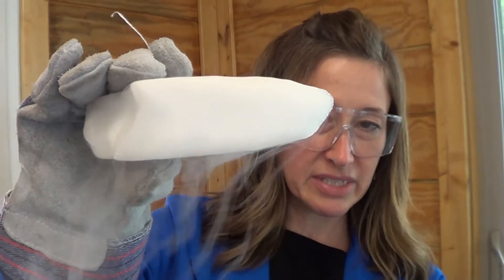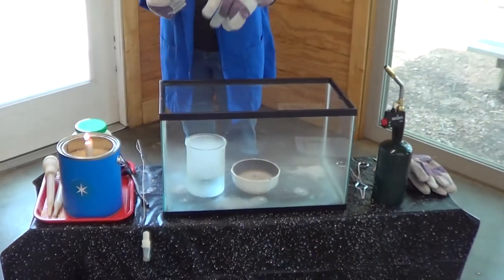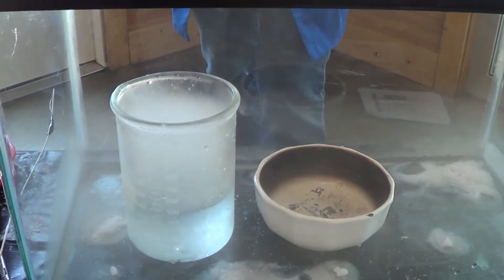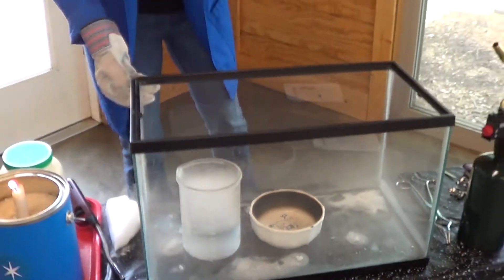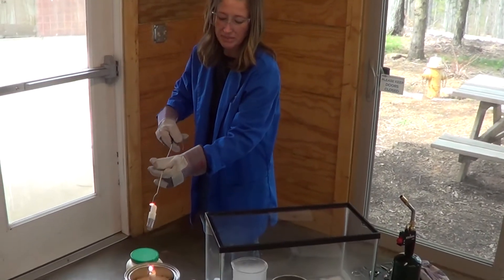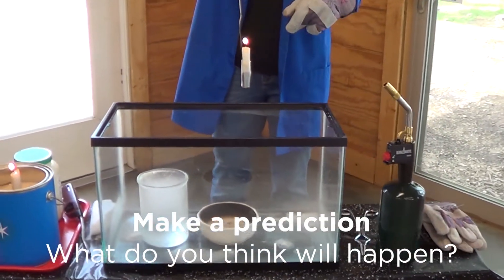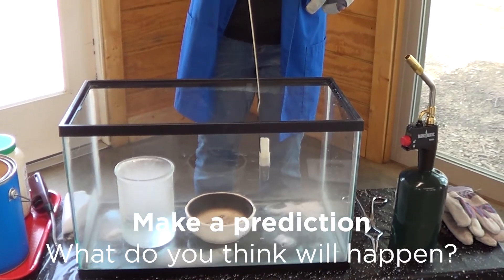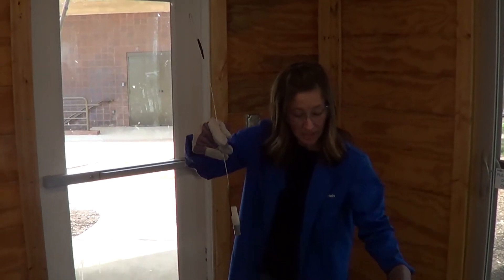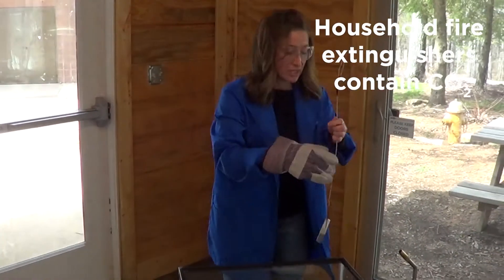What we're going to do is use that property to fill my tank with carbon dioxide. Before we started, I put some dry ice in our beaker there and we filled this whole tank with carbon dioxide. You can't quite see it, but let's test it. We're going to take a candle on my little holder and drop it down into our tank of carbon dioxide. Make a prediction about what you think will happen. Alright — our flame went out. We're missing something from our fire triangle: our carbon dioxide displaced or pushed out all the oxygen, so we did not have that reactant for our reaction to occur.